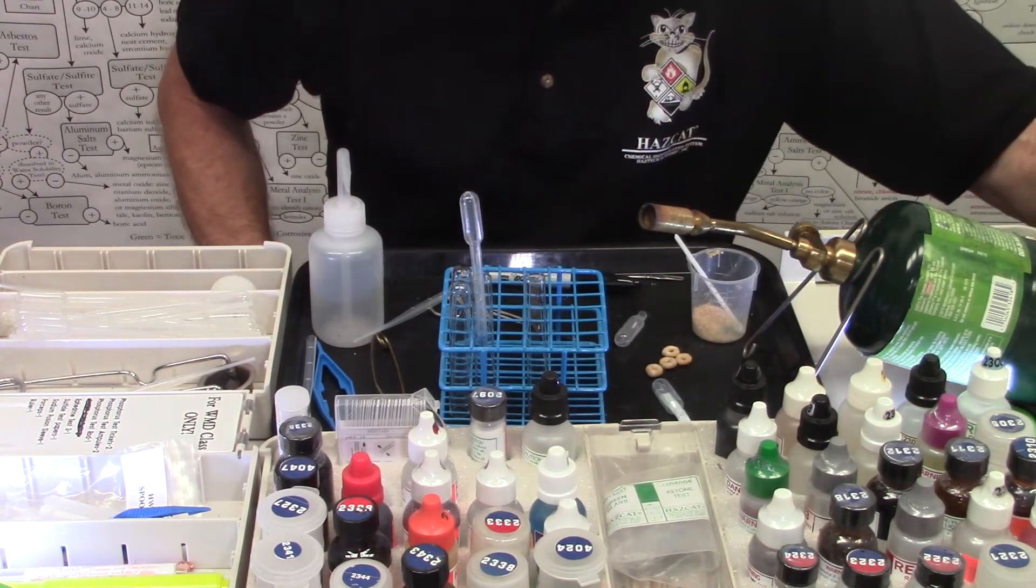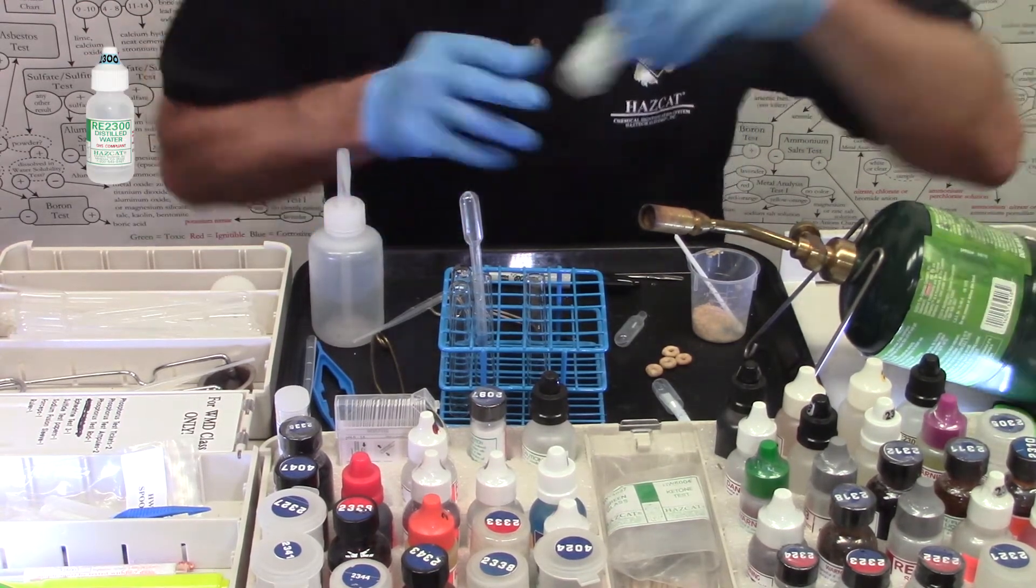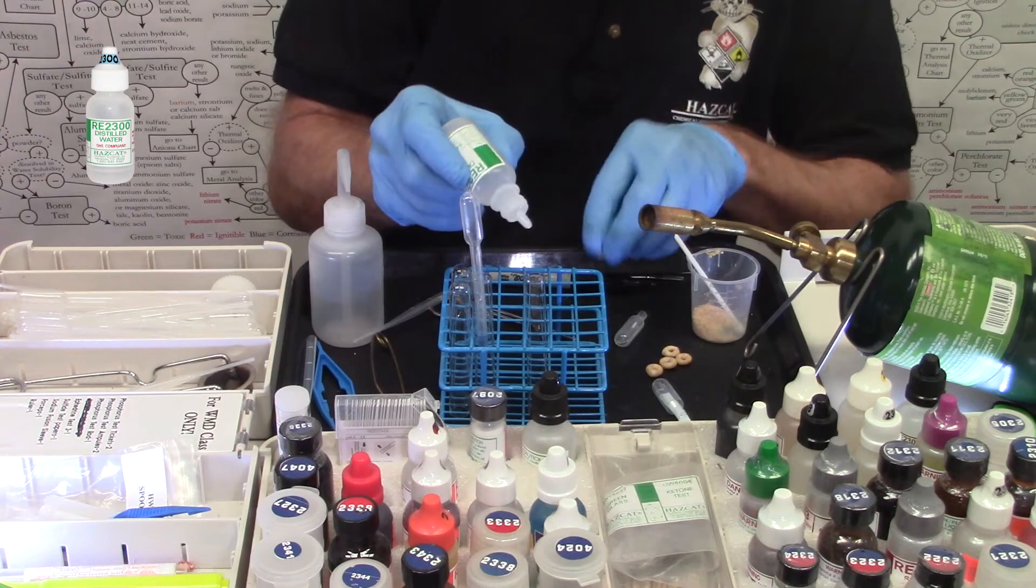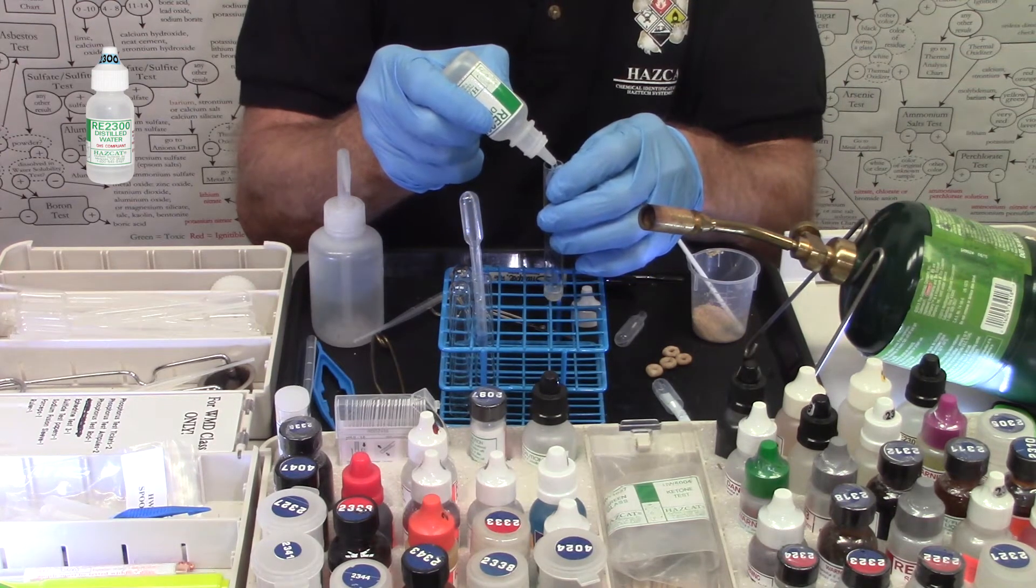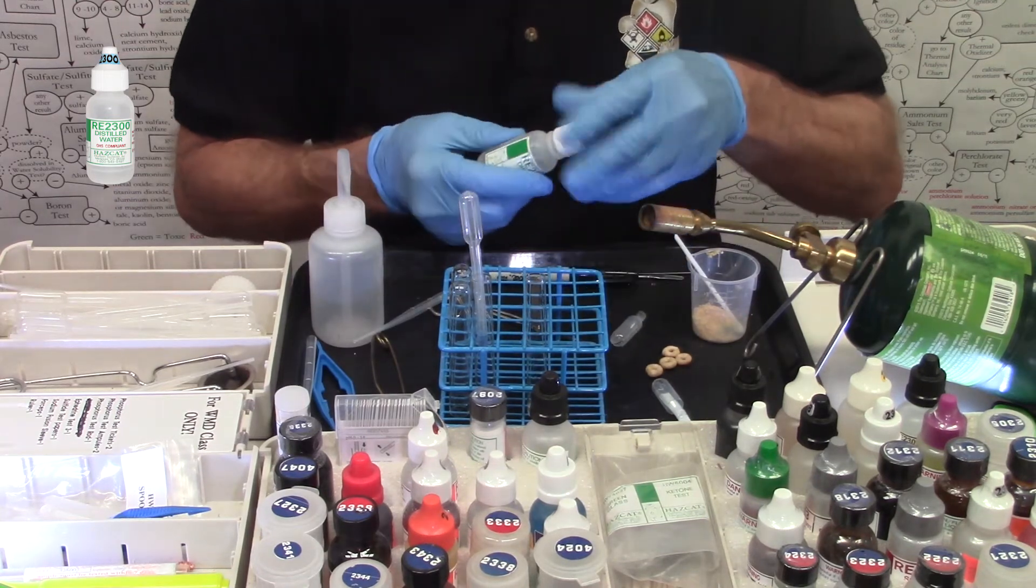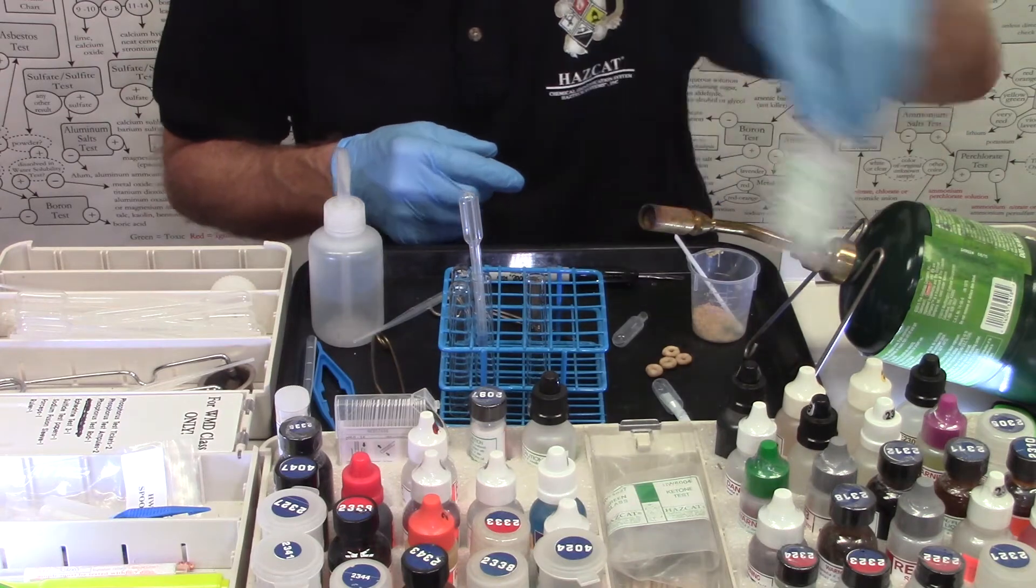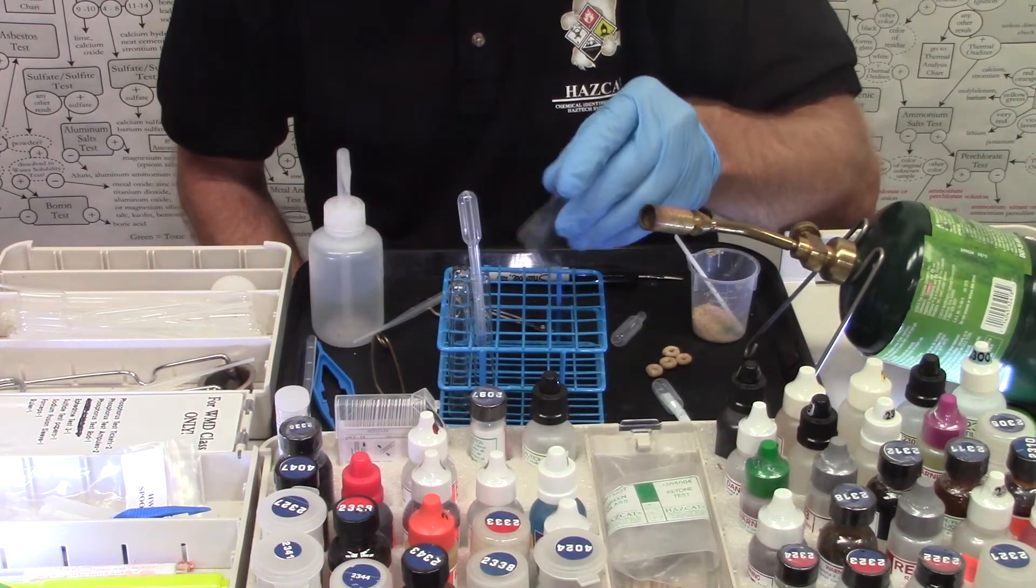And now I'm going to take and add, since it's a solid, one-half inch of water. Shake for 15 seconds. That was RE2300 distilled water.